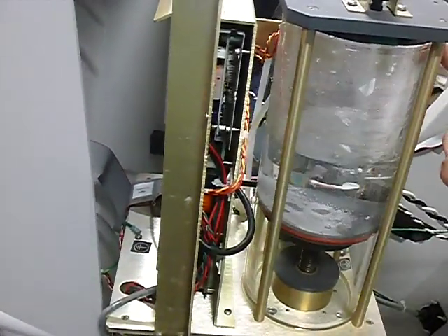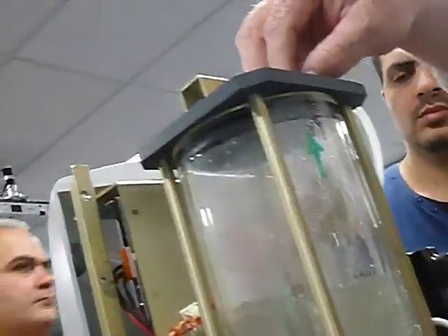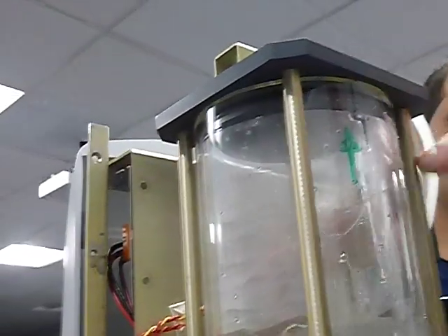Okay? So it's coming down, and that's just the way it's getting drawn in. Oh, okay. It's not a leak. No, it's not a leak because it's inside. It just drips down. All right.